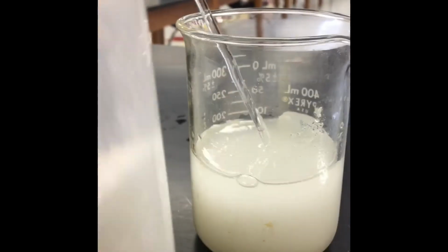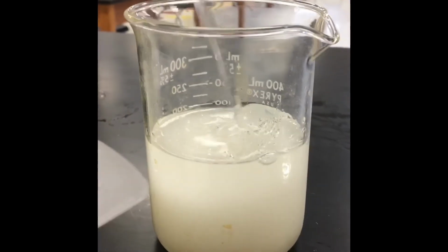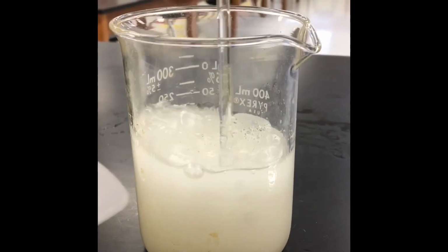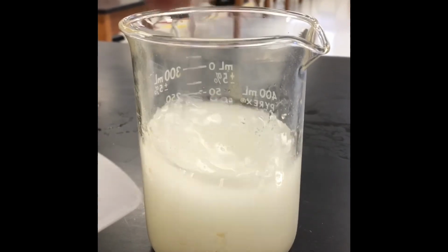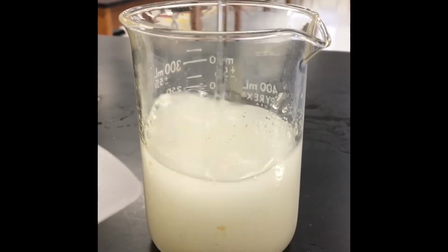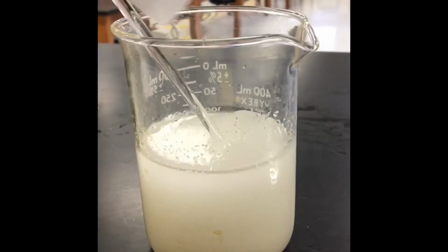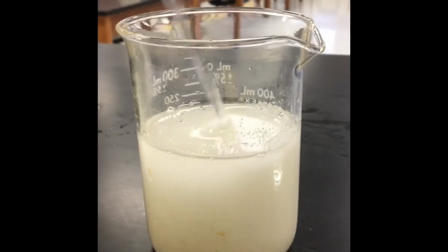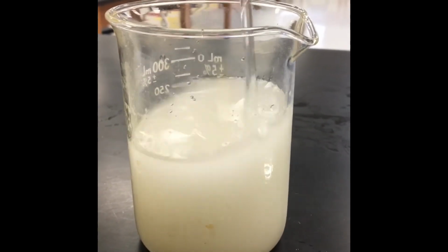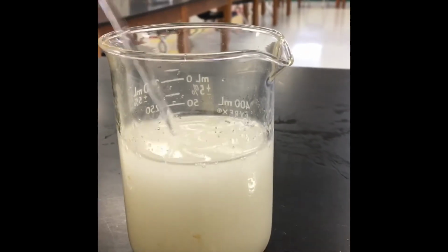Okay, and I don't just dump it in all at once. I put in, you know, a good chunk, I stir it a little bit. So this takes patience, and I do have some machine tools that I use to stir solutions. It could take anywhere from 5 minutes to 2 hours to really dissolve well. So I'll probably let this sit for a while and stir it periodically and see if I can get it all dissolved. Okay, so that's everything in the room temperature beaker.